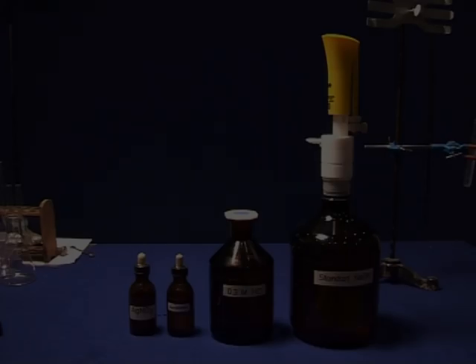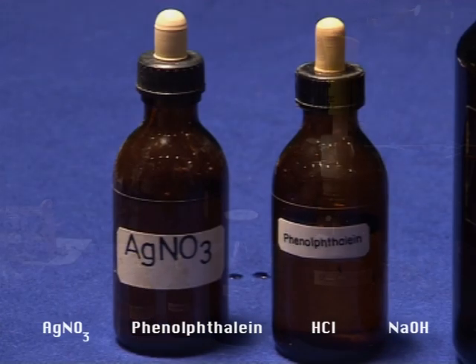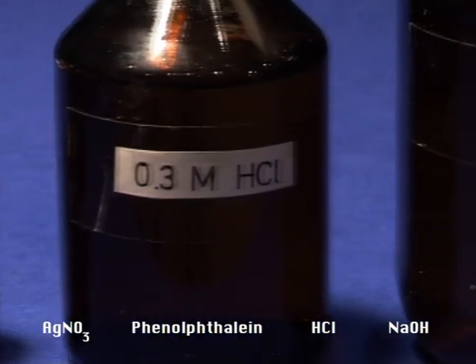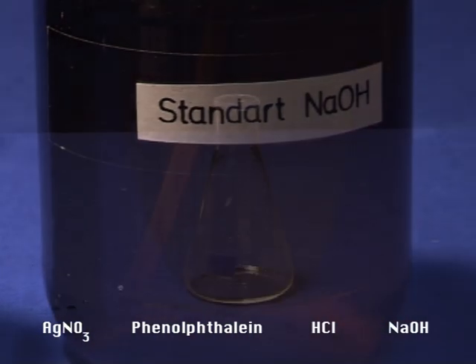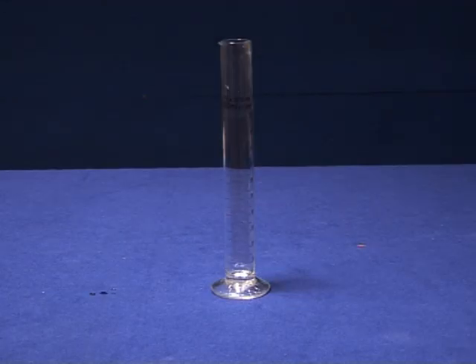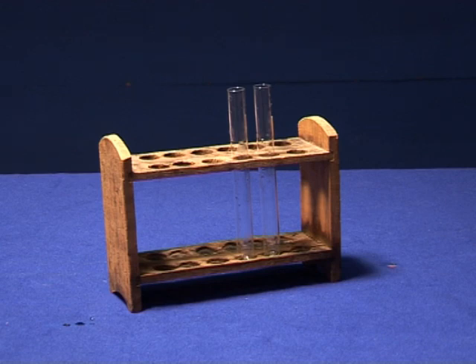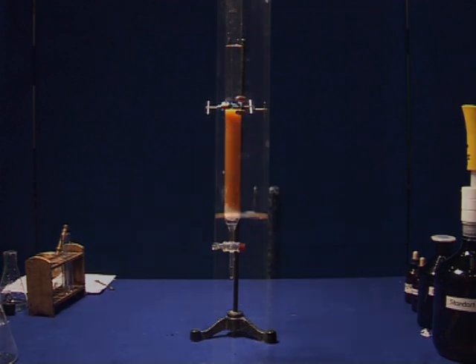Chemicals and apparatus: Silver nitrate, phenolphthalein, hydrochloric acid, standard sodium hydroxide, Erlenmeyer flask, burette, test tube and tube rack, ion exchange column.